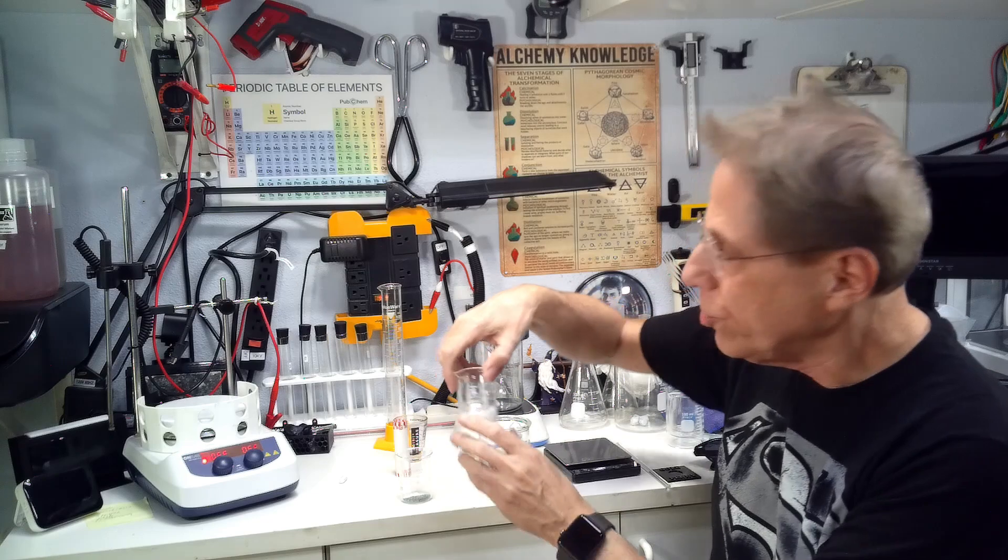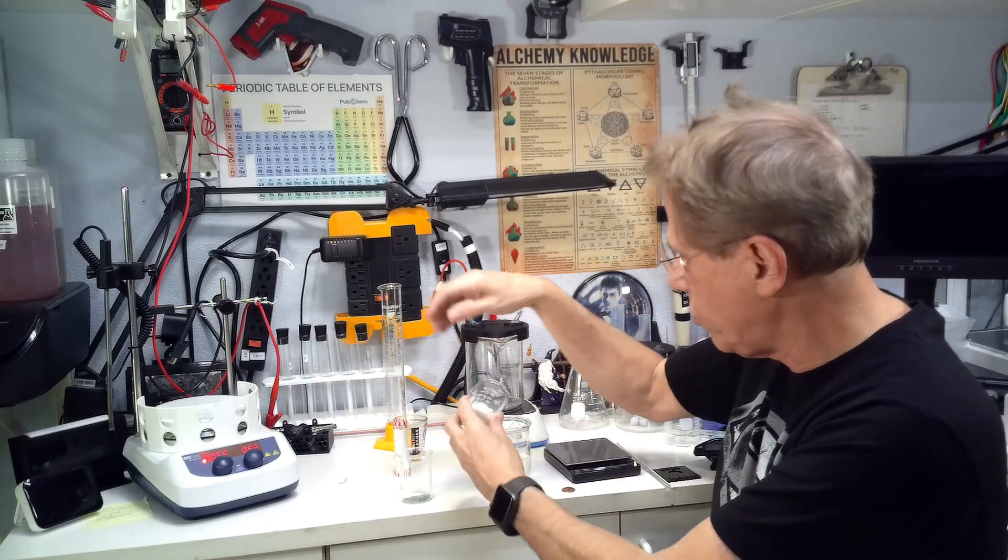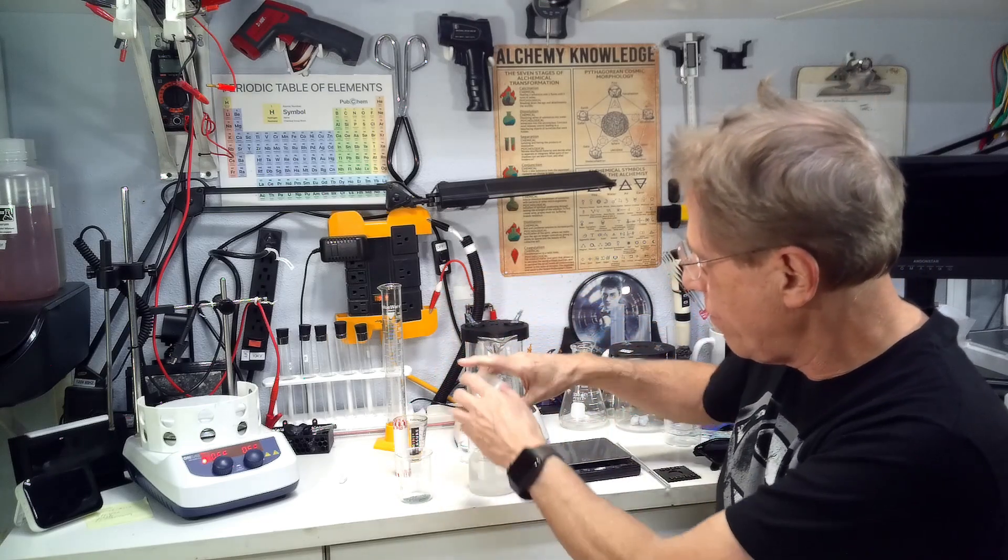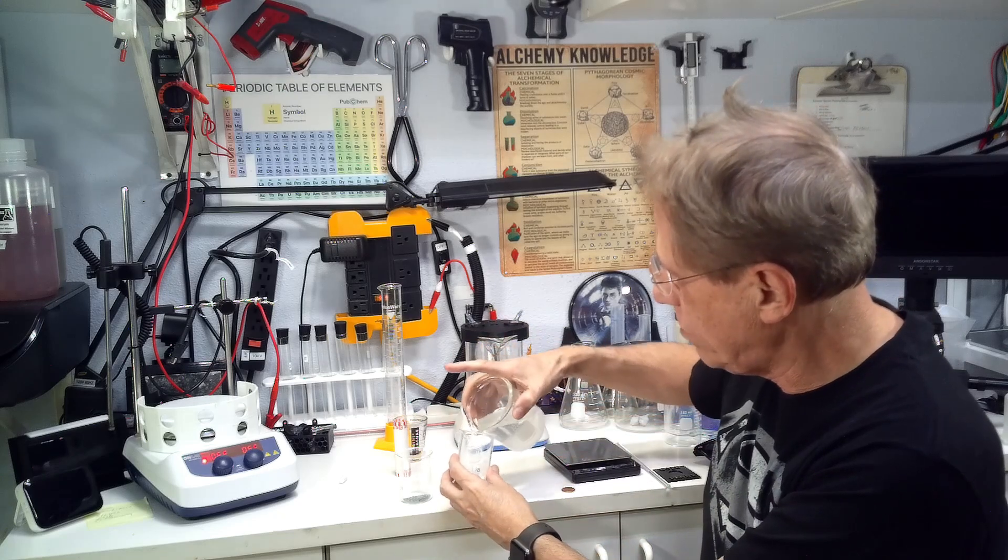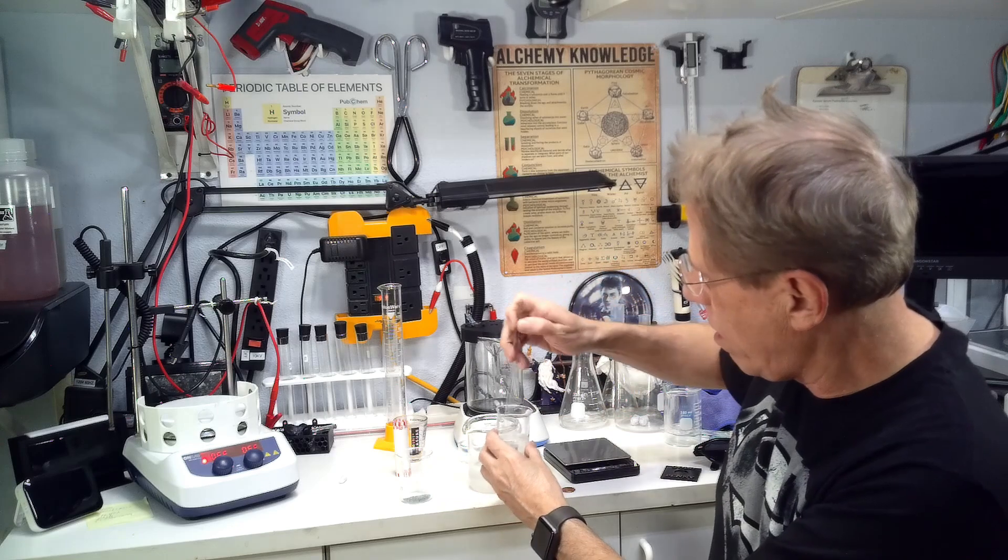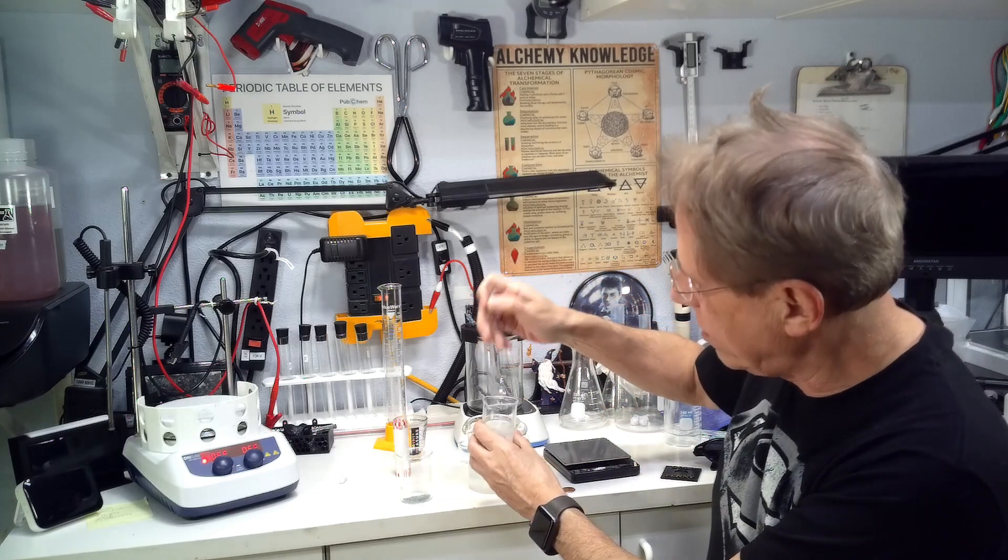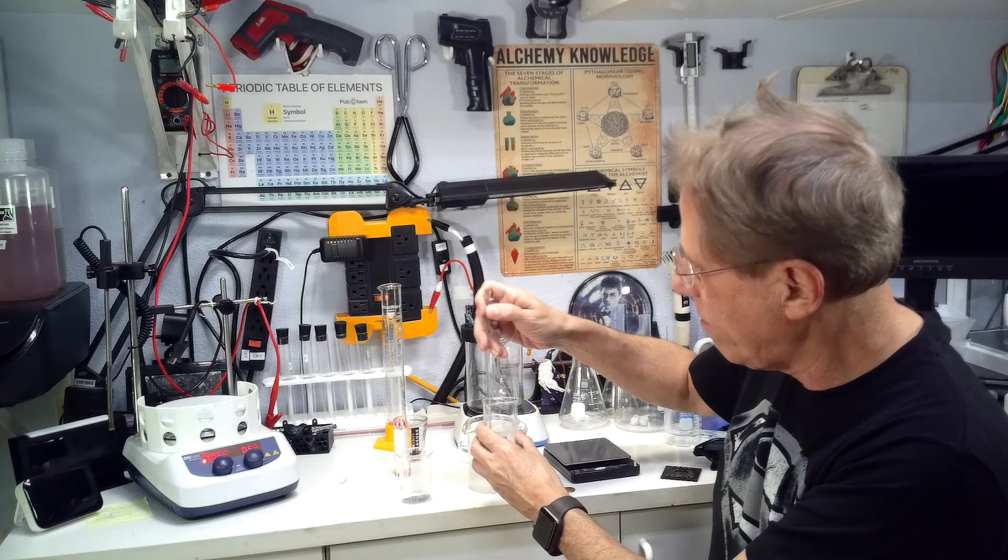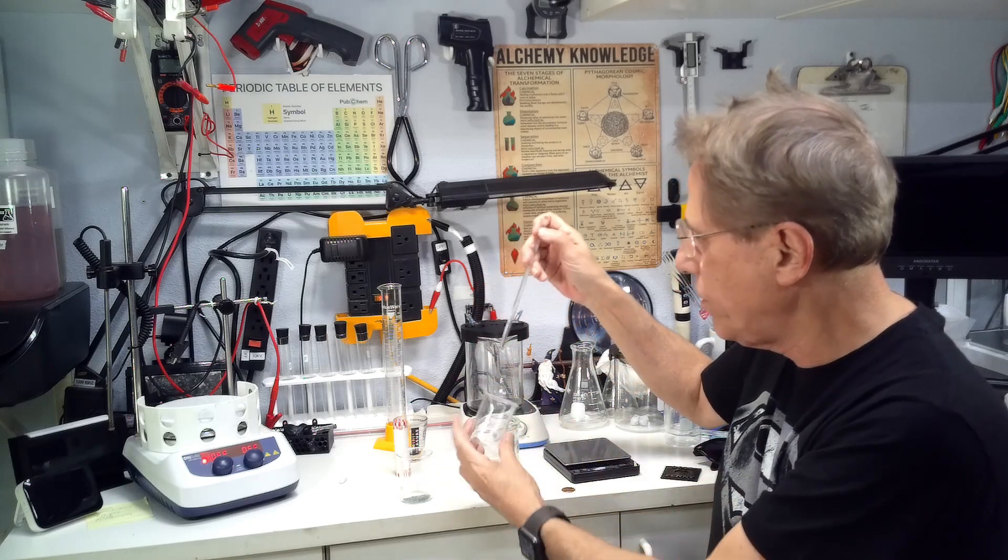And the first thing we're going to do is take this and mix it in our beaker here. I'm just going to pour some in here. Make sure we get all of the stuff collected that was in that beaker into this beaker.